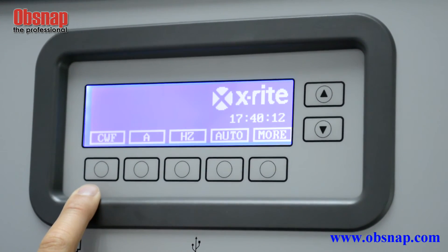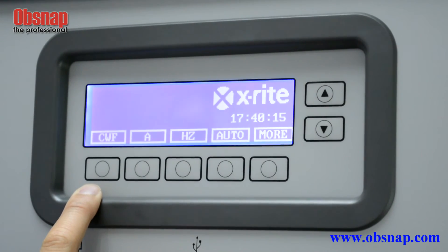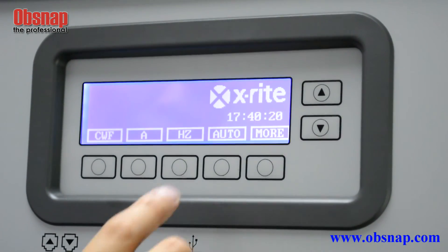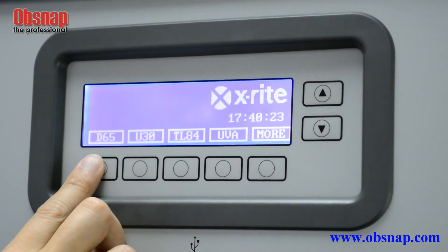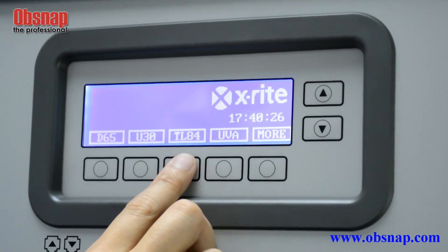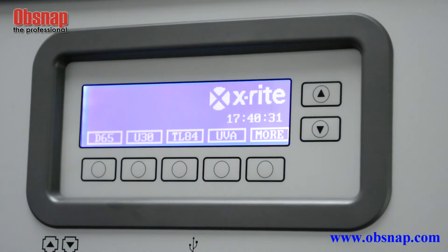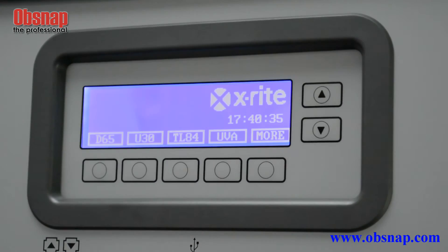Why do we need to choose different light sources? Because of the metamerism effect. Sometimes when we view colours under different light sources, the colour appearance will be different. For example, under D65 light source, two colours may appear the same. But when we switch to TL84 or another light source, the colour appearance will appear differently. This is the main application of the colour box.